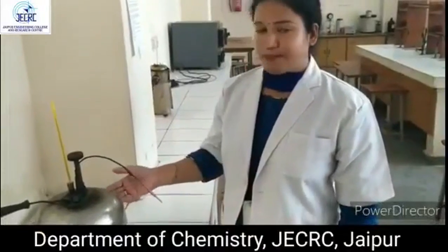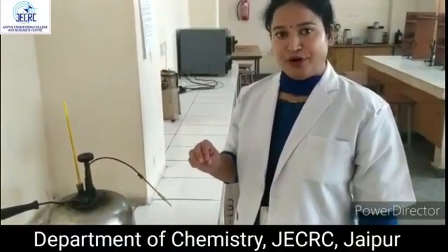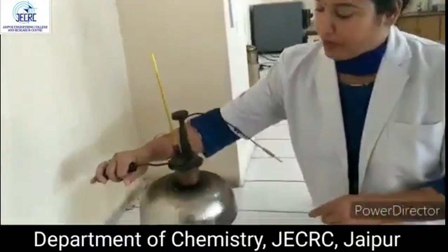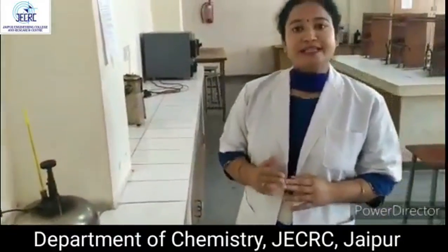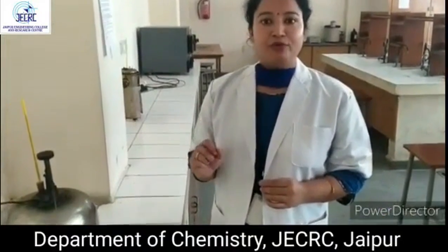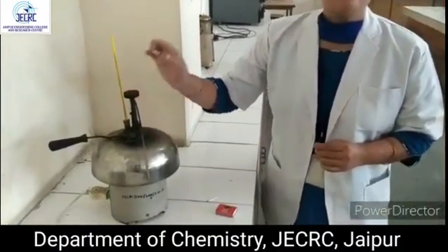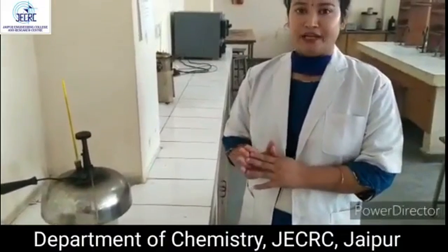Now, with this Pensky-Marten apparatus, we have to find out the flash point of the lubricating oil which we have taken in this calorimeter. Now, what is flash point? Flash point is the point where a pop sound appears and a spark for 1 second appears. That we have to note down, and we also note down the temperature at which the flash point appears. So this is the flash point of a given lubricating oil.